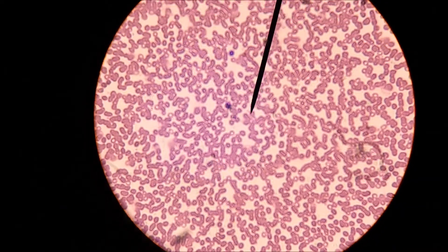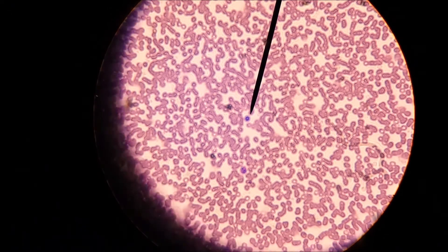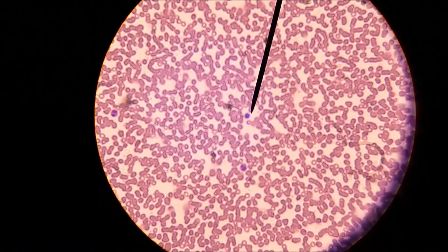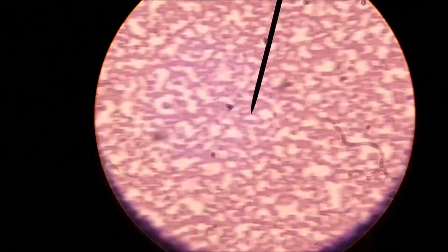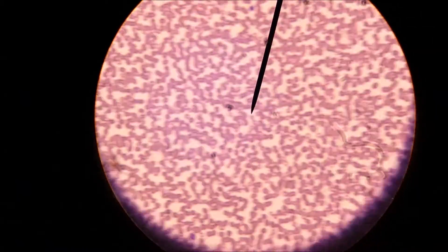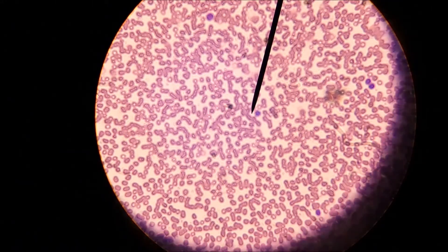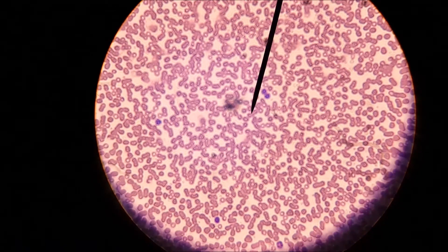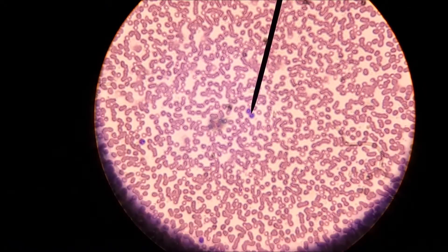The cells I'm trying to show you here are about the size of a period on a page to me, so I can't actually make out the details of any of these. But you can see some white blood cells.